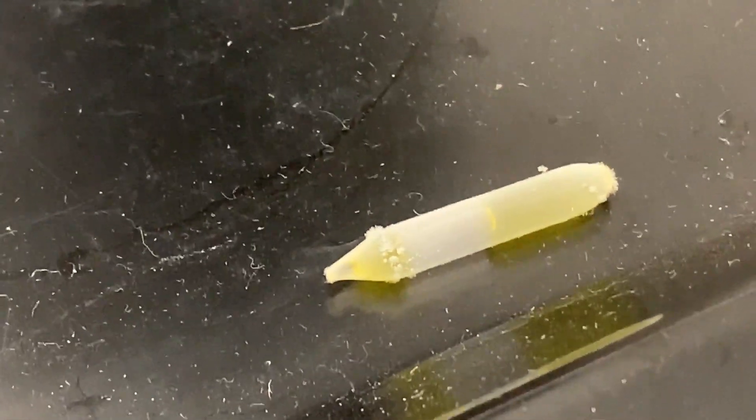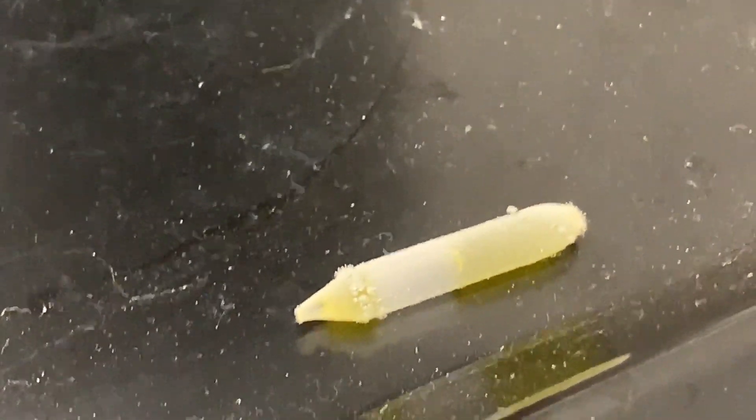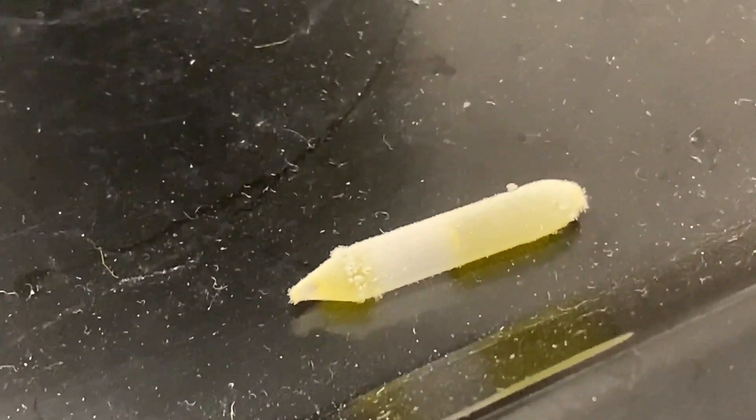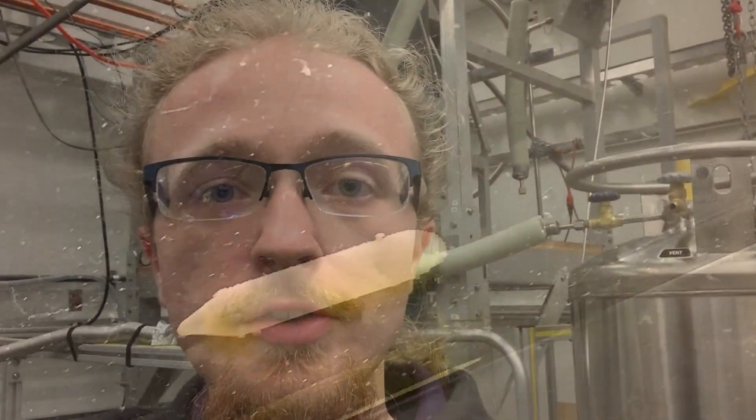Now it's all liquid. I got a perfect shot of that. So you have now seen solid chlorine — you saw the frozen Cl2 — and you also saw it melt, which I thought was the coolest thing ever. It's actual chlorine ice.